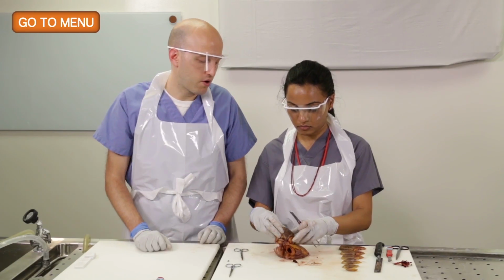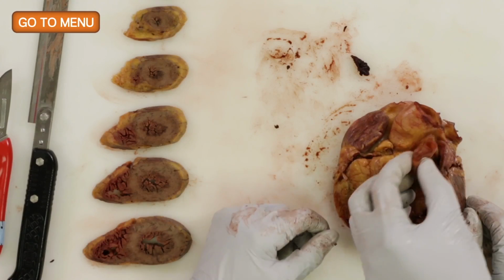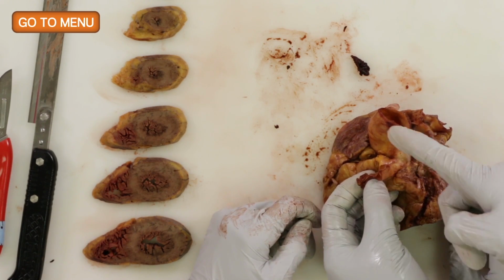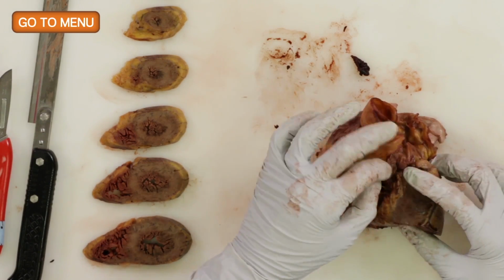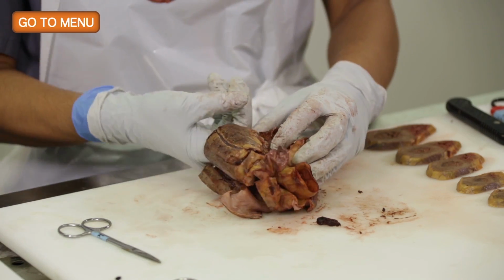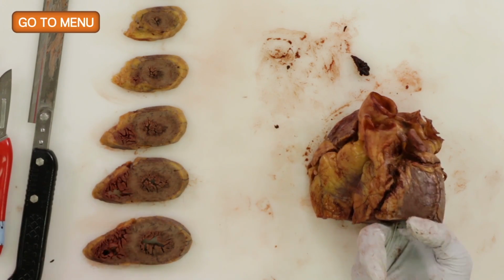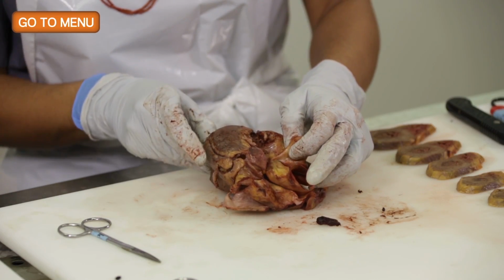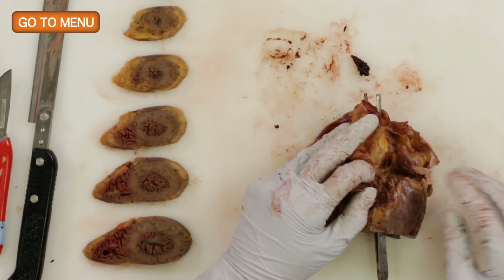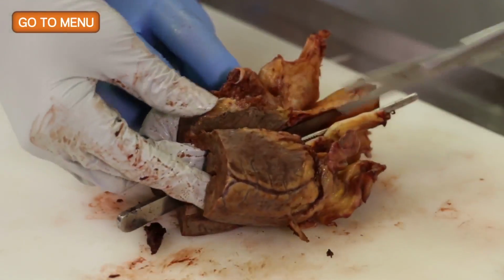Okay, so then the final cut is from the left ventricle through the aorta, and this is where we had to reflect the pulmonary artery. So if you go back to the front of the heart, which we've done, then you reflect the pulmonary artery out of the way, and the final cut is along the septum anteriorly right through the aorta like that. Again, it's nice to probe a little bit. You see it coming out here. The ventricle is a little thick, so get a good pair of scissors.